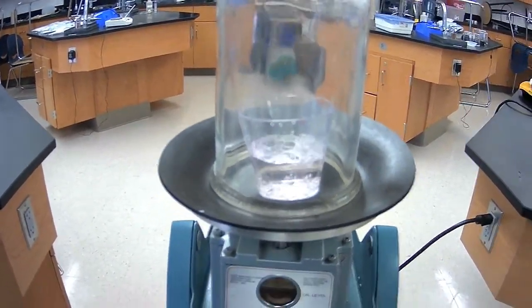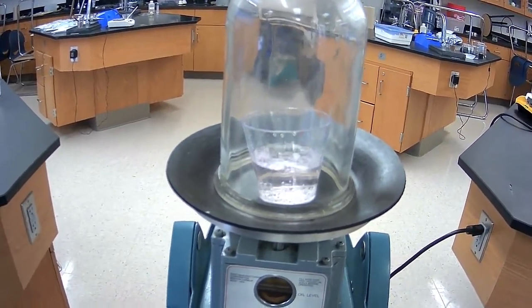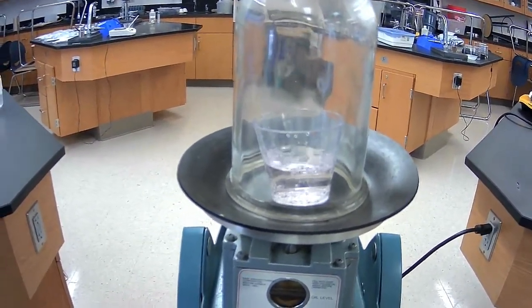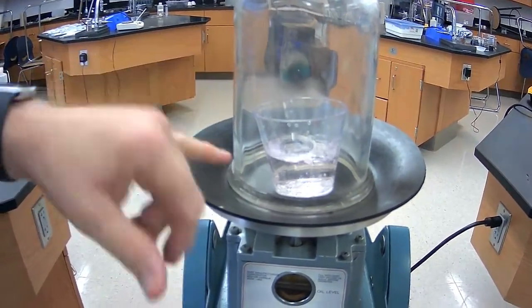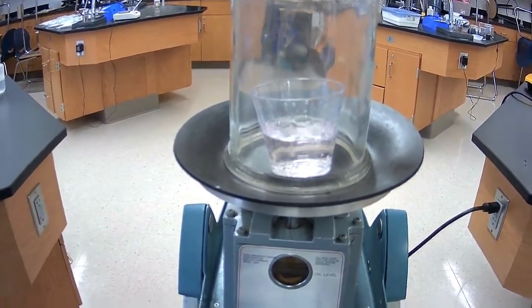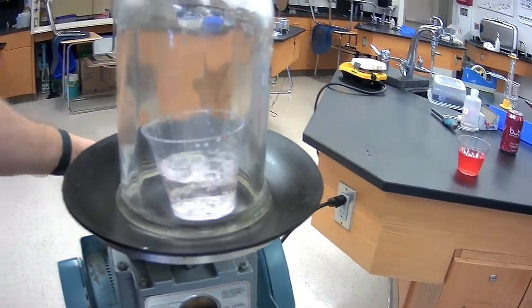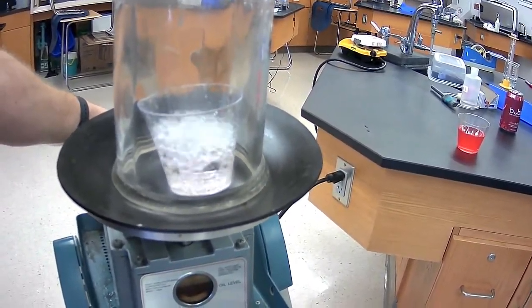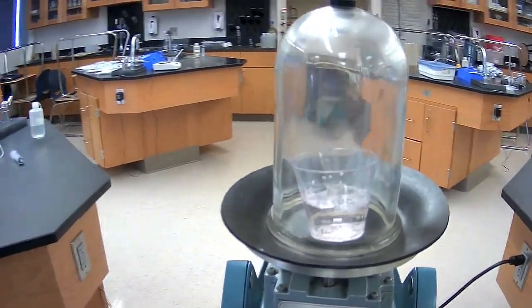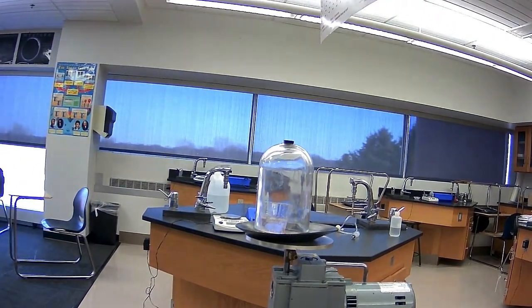This is not boiling. Previously in our demonstrations, we saw the effect of boiling water at room temperature by decreasing the pressure. Now, in this case, I'm not putting enough vacuum in here to cause that boiling effect. All we're seeing is the extra carbon dioxide that was in solution being driven off because we're decreasing the pressure. Okay, so once again, we see that happen very quickly, and we see how much carbon dioxide is actually inside these soda solutions or carbonated beverages. Okay.